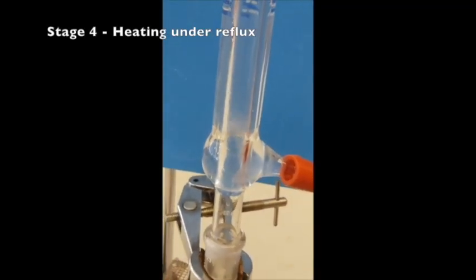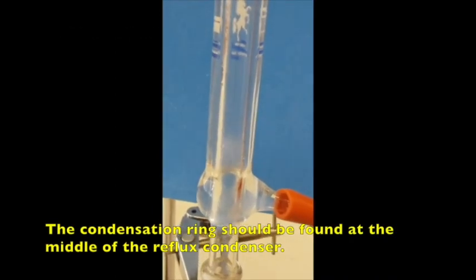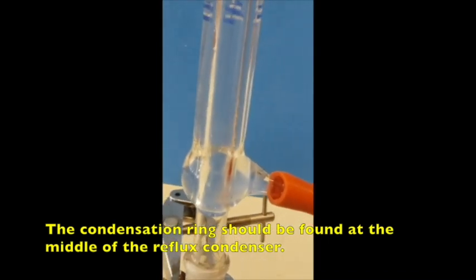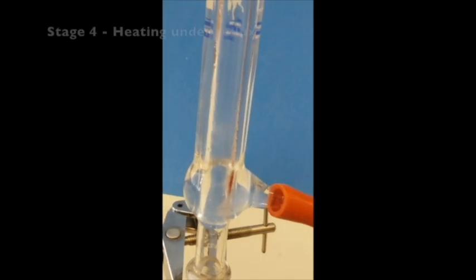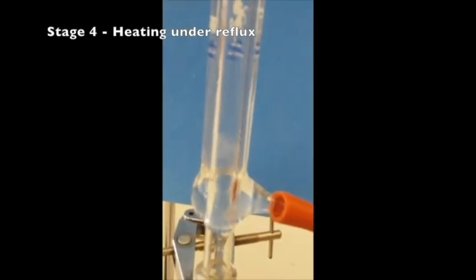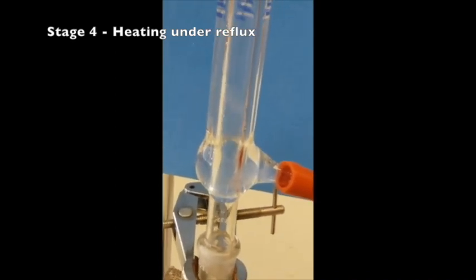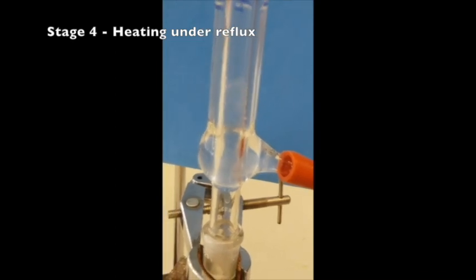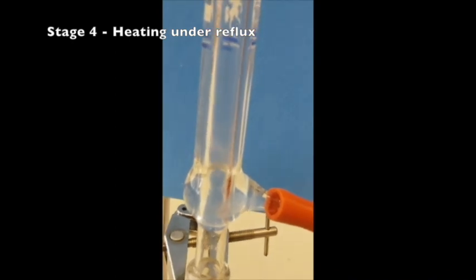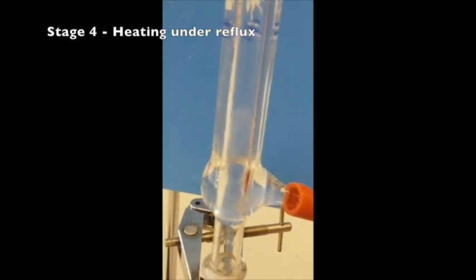Now, as you are doing the reflux, try to pay attention to the condensation ring. Try to make sure the condensation ring is within the center of the reflux condenser. If the heating is too vigorous, chances are the condensation ring may move to the top of the condenser, and this is not desirable because some of the vapor may escape from the condenser. If that takes place or you simply realize that the heating is too strong, try to remove the heat a little bit, adjust the air hole or the air supply so you can get very consistent heating where the condensation ring is within the middle of the reflux condenser.